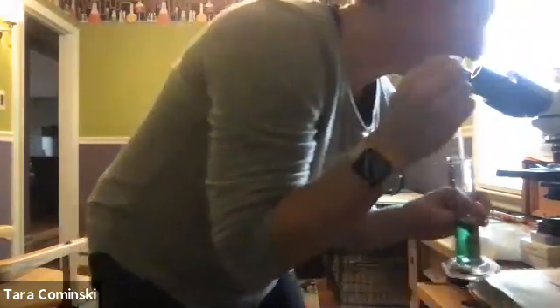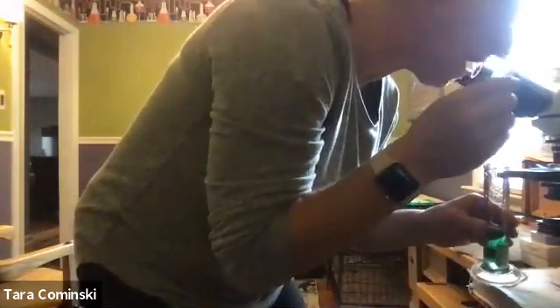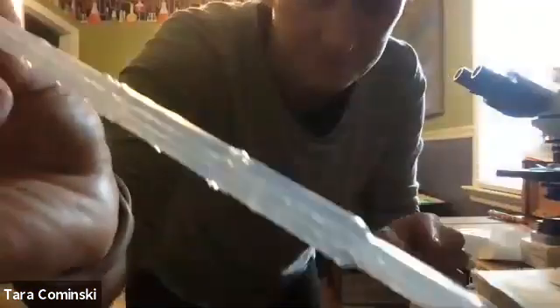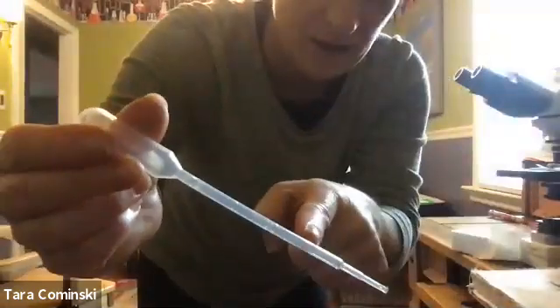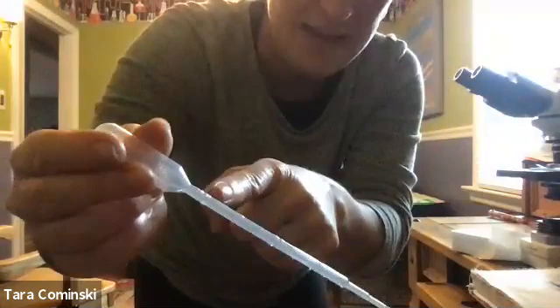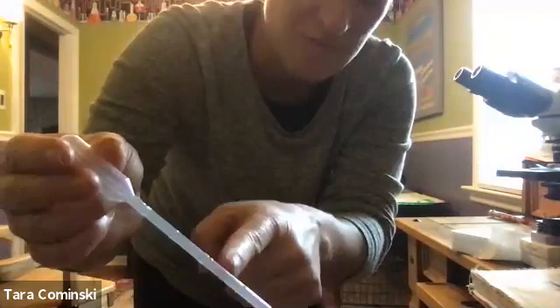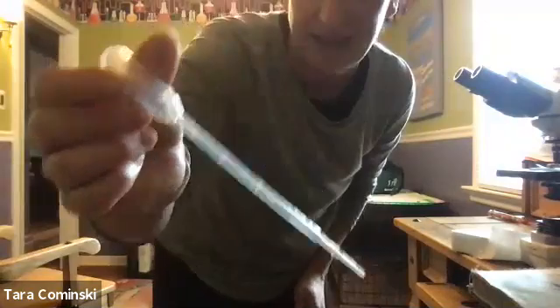All right, number 6. It says some pipettes are graduated and can be filled to a certain level as a way to measure volume directly. You can kind of see there's little lines on here, and that's graduated. So this is 1 milliliter here, right? So this would be 0.25 milliliters, 0.5, 0.75, and 1. So you can actually use this to estimate the volume, to sort of measure it directly.